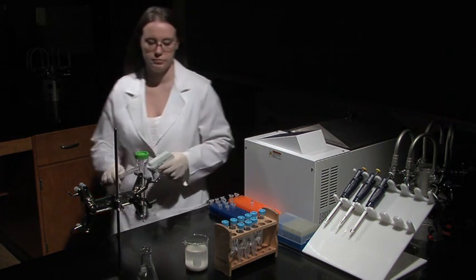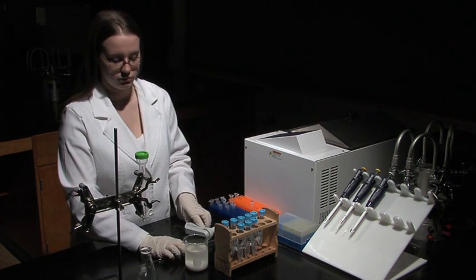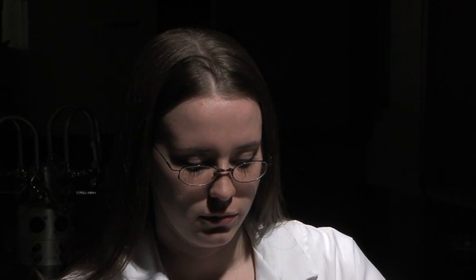To begin, vertically mount the column on a ring stand. Make sure the spout on the bottom is capped. Stir in the cellulose mixture and then carefully pipet it down the side of the column.